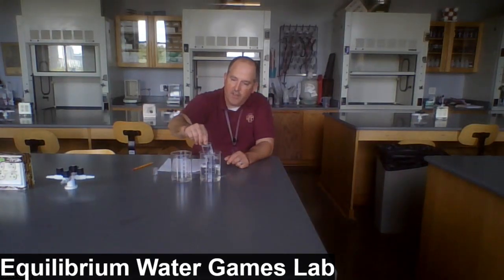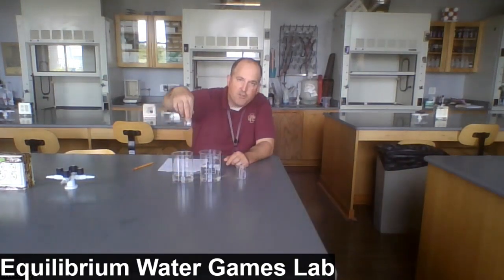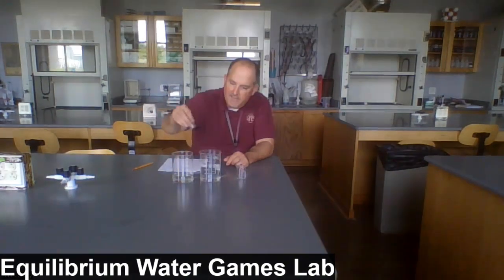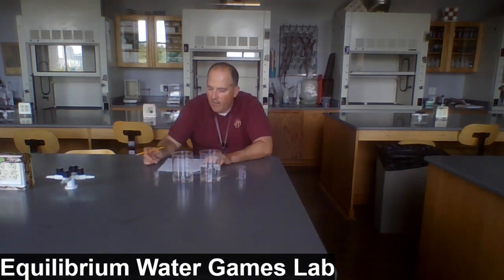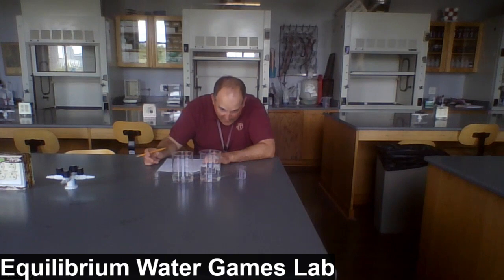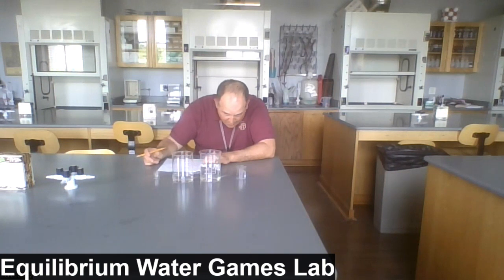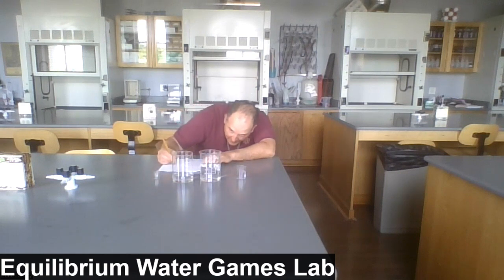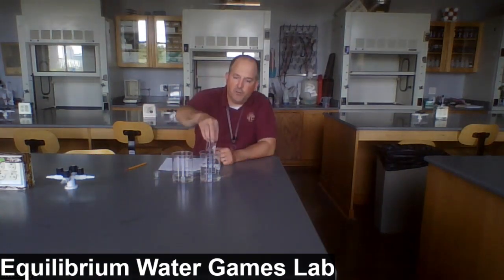Now for transfer cycle 3, I'm putting as much water as I can in the 50 milliliter size beaker and transferring it. And then now I'm getting a much fuller amount of water in the teeny tiny beaker and transferring that, and recording now our volumes after transfer cycle 3. I'd say I've got 360 milliliters of water in A and 150 in beaker B. Again, we'll do another transfer cycle.